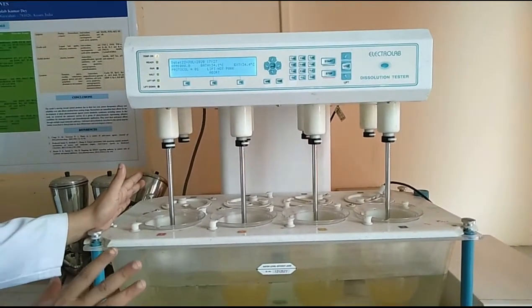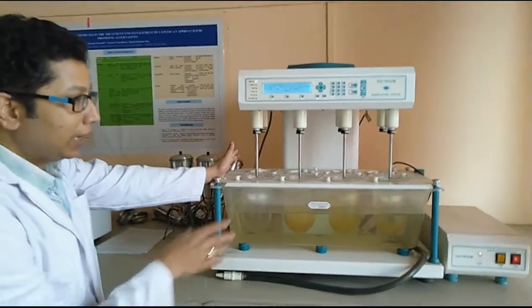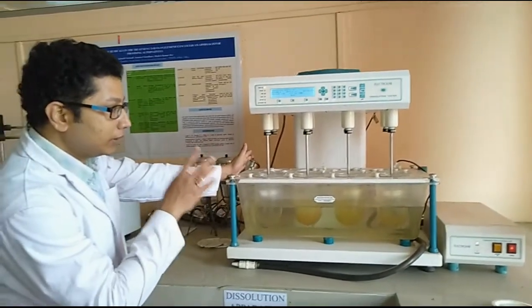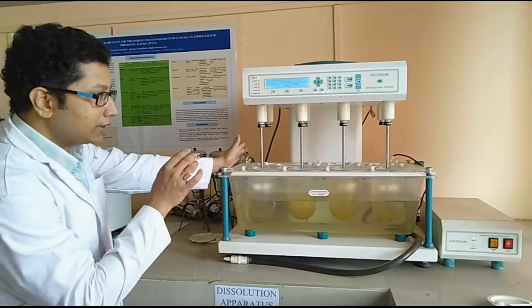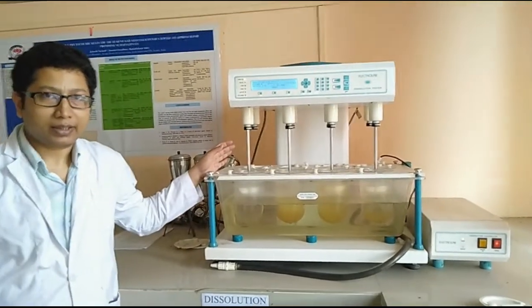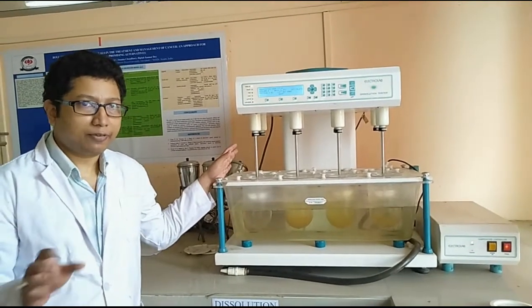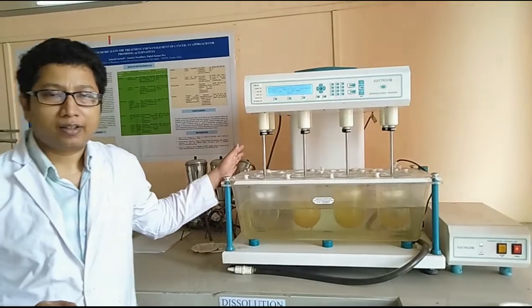We have already set all the parameters which are needed to perform the study, and now we are going to put the tablets inside the pan and start the study. Before starting the study, I just want to brief a few details which are most essential for performing the dissolution study.